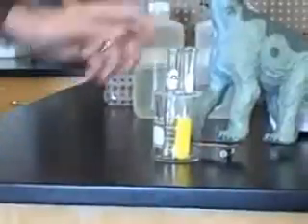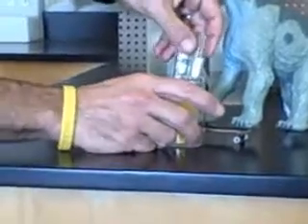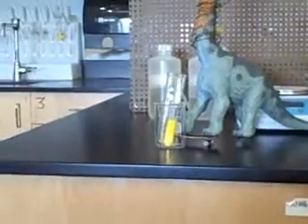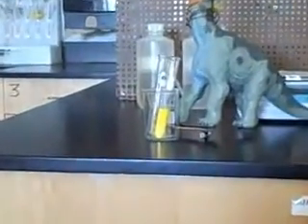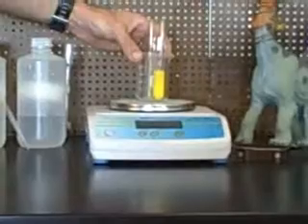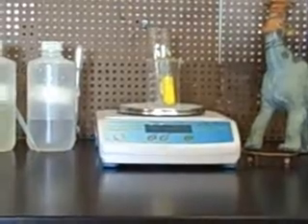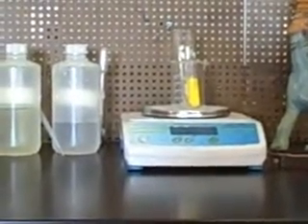So, jot down. That's good. Now this is tearing. It is 80.25 grams. 80.25 grams. 80.24 grams. It's fluctuating between 80.25 and 80.24.